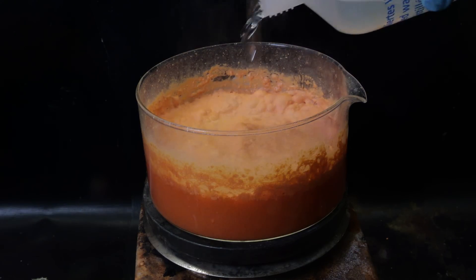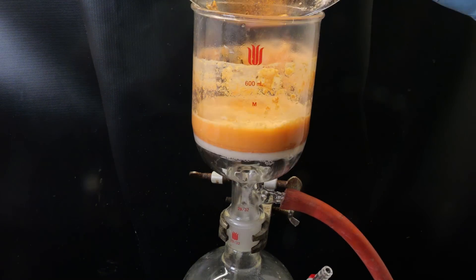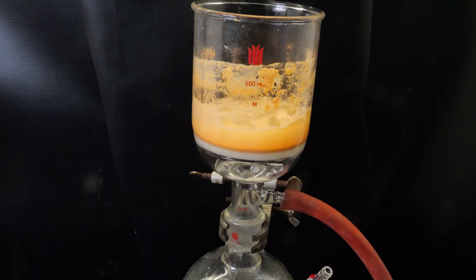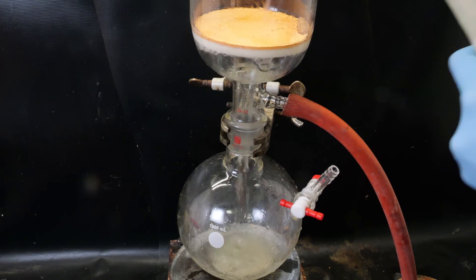I then filter all of it again and wash it with water. And the filtrate is slightly yellow. I discard that and I then wash it with acetone, which also removes more impurities.